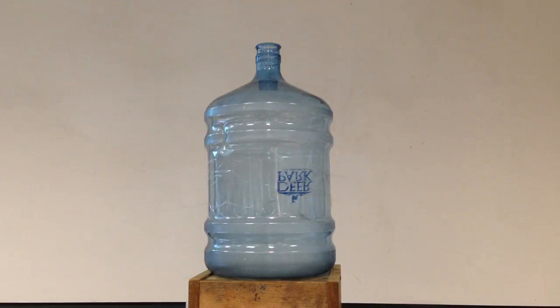Believe it or not, as we've talked about, wood has different types of volatile chemicals that include wood alcohol, famously called methanol. So what I'm going to do is I'm going to add some methanol in this container.